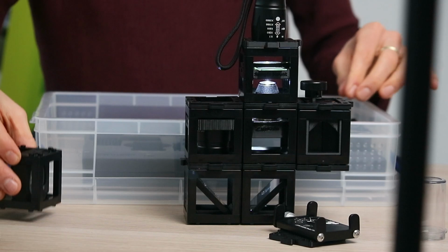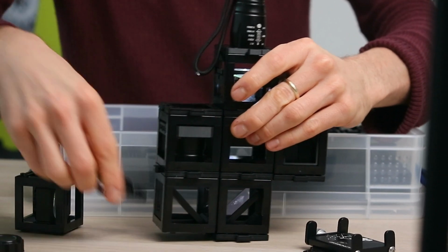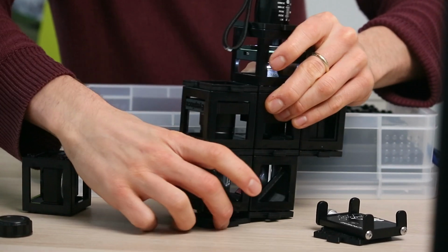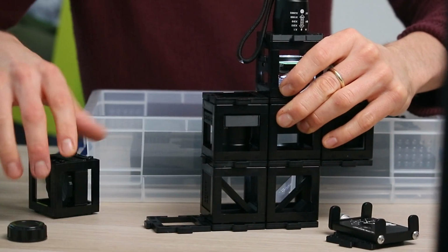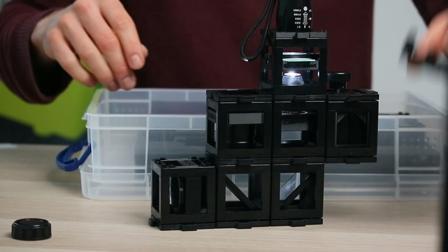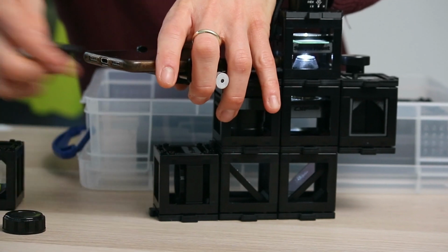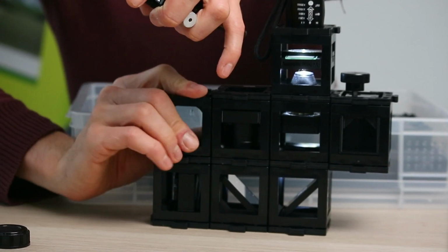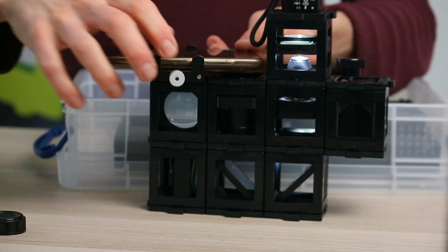And then in order to mount the part here, we add this. And then eventually, where is this part? Thanks. In order to make it a little bit more sturdy, we add one more puzzle piece here. I forgot. So like that, and then again like that.